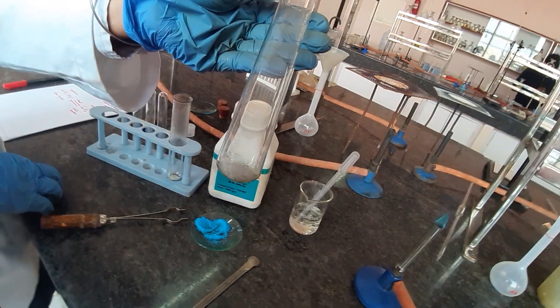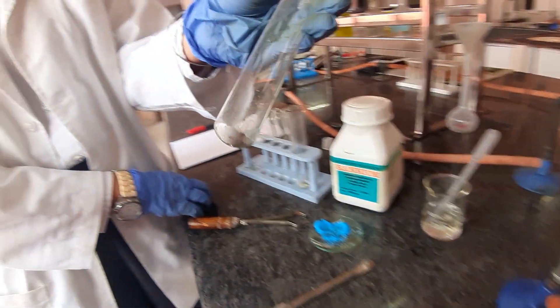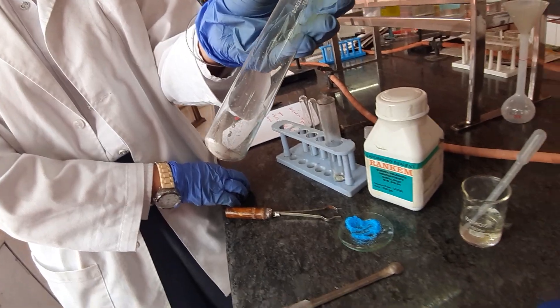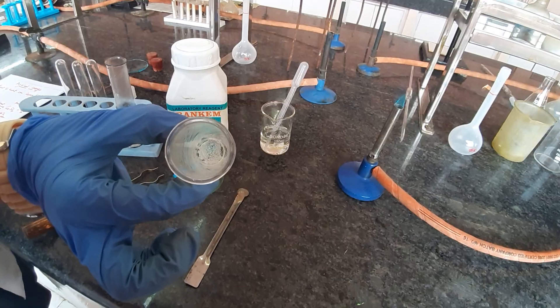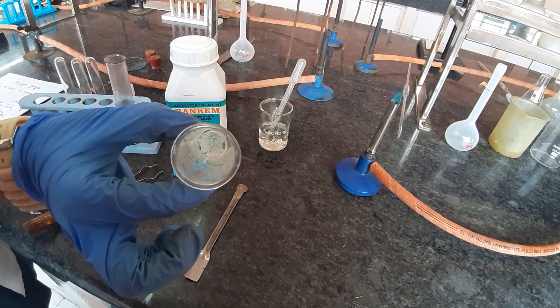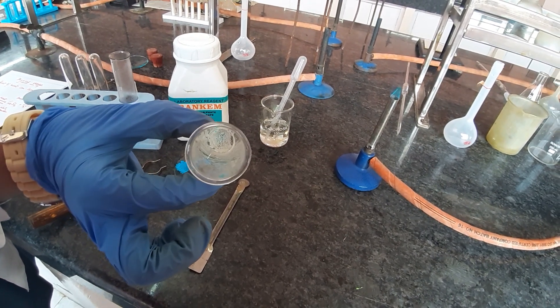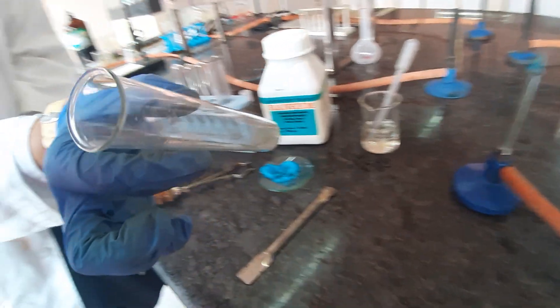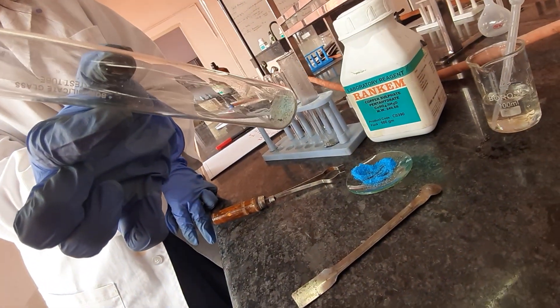This is the state of the copper sulfate after you have heated it completely. You can see the total amount of copper sulfate crystals has now turned to white because of the loss of water.